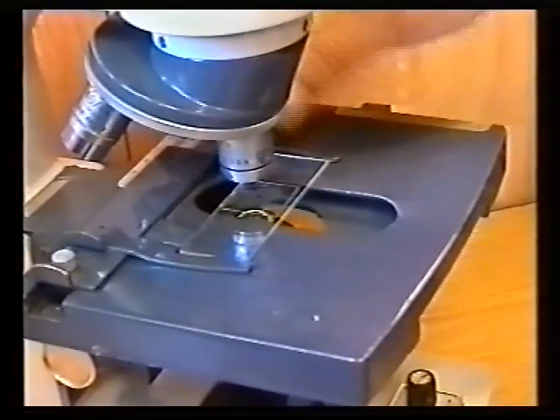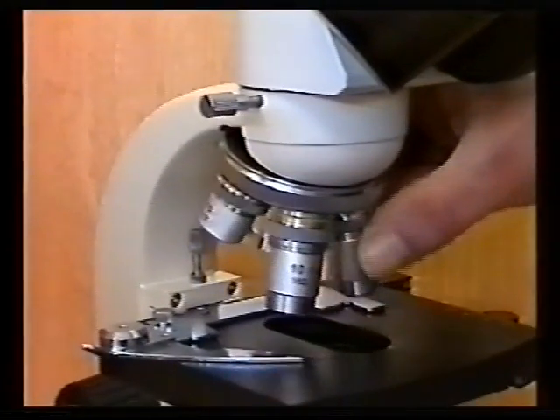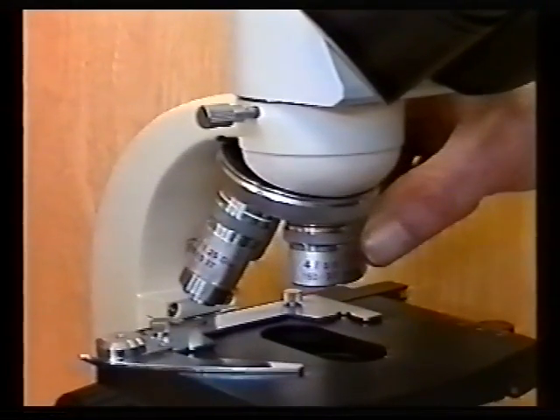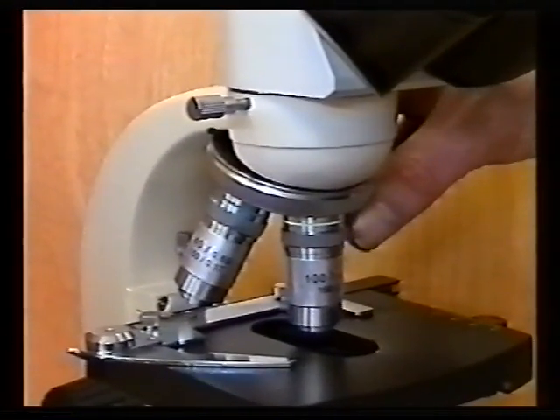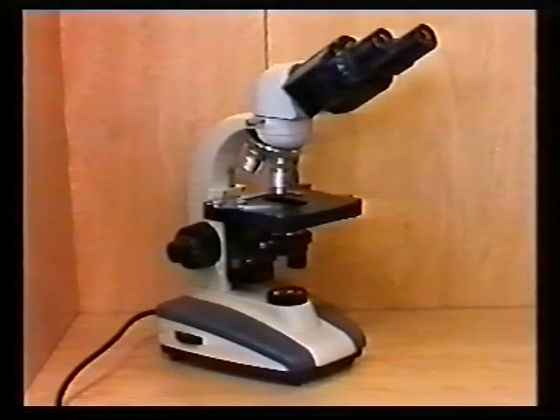When identifying parasites, an essential part of your armoury should include a microscope for positive identification. Microscopes come in different shapes and sizes, sporting various gadgets and filters. Depending on how much you are willing to pay, there are monocular with a single eyepiece or binocular with a double eyepiece. The binocular type tends to be much more expensive.